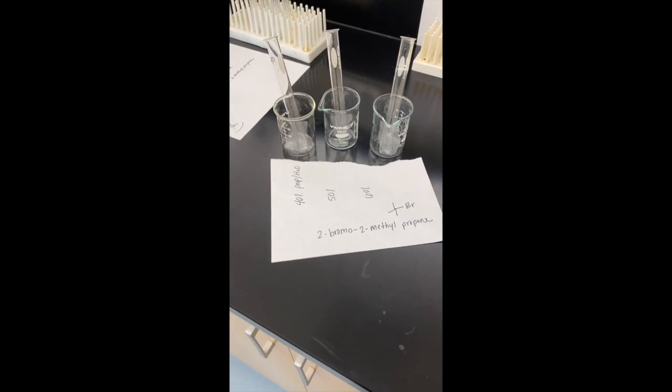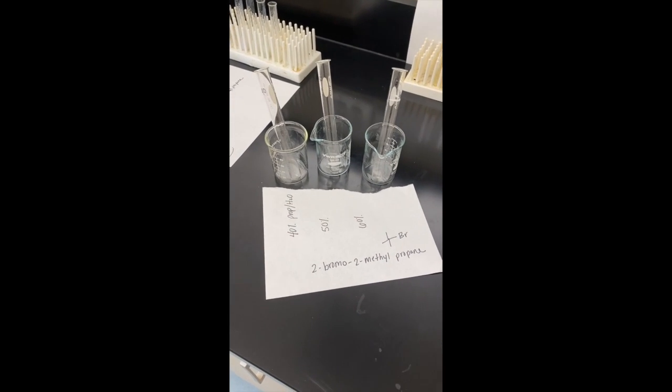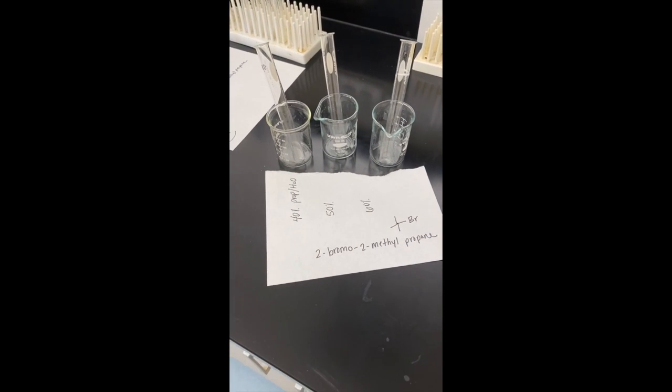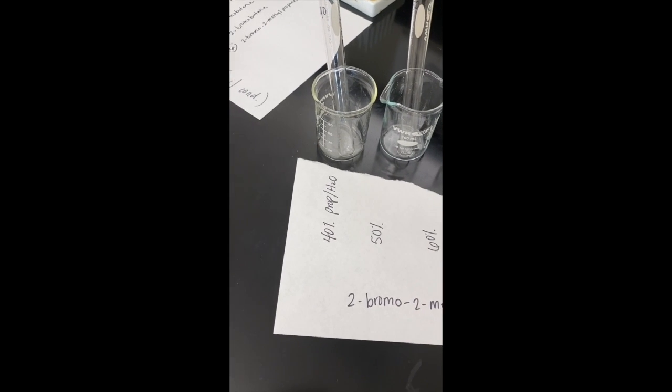All right, so now we're going to do some tests with our solvents to see how increasing the polarity of our solvent affects the rate of our reaction. So we're going to just do 3 main tests with different concentrations of water with propanol. And so that's going to be our solvent, and we're only going to test this specific tertiary alkyl bromide because this alkyl bromide favors reacting in our SN1 conditions. So we'll see how increasing the polarity of the solvent affects the rate of this substitution reaction.